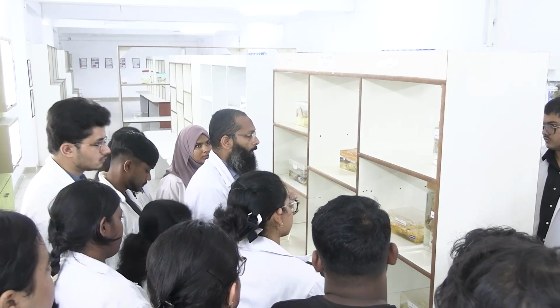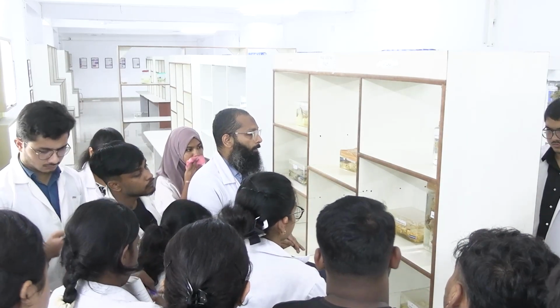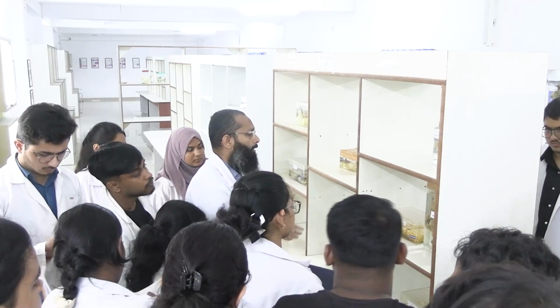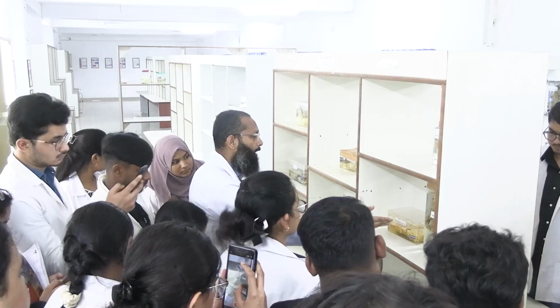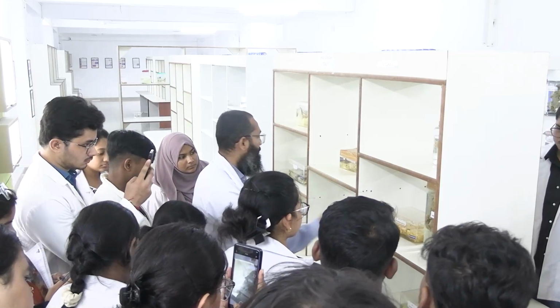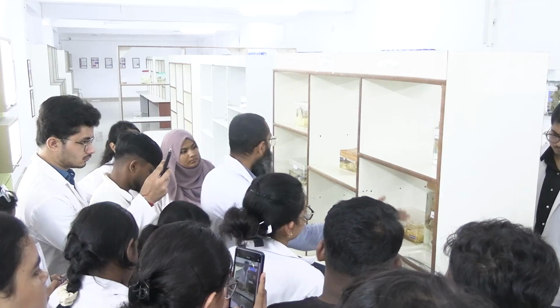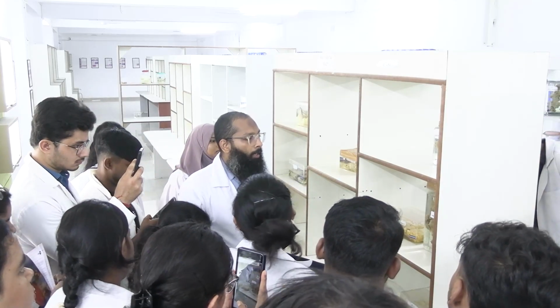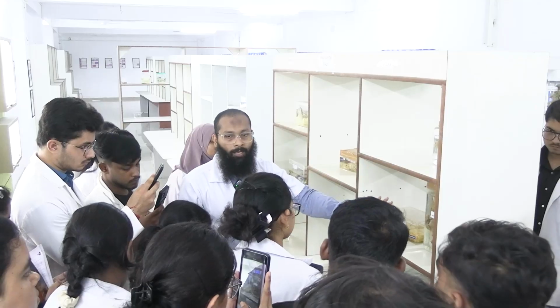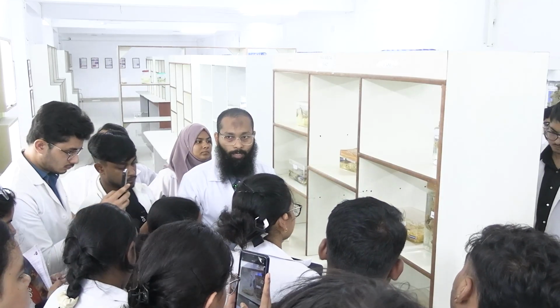You have to say that there is a mass present, which you can describe by its color. You can say that it has ill defined margins, the margins are not too well defined, okay. You can say the measurement of that mass, and the thing which is not possible here, but that is also important, is the location of the mass, okay.